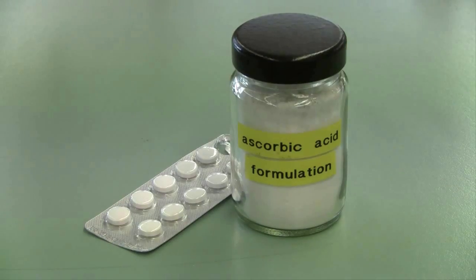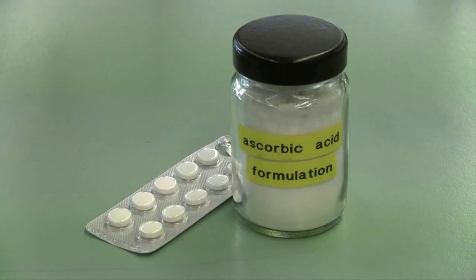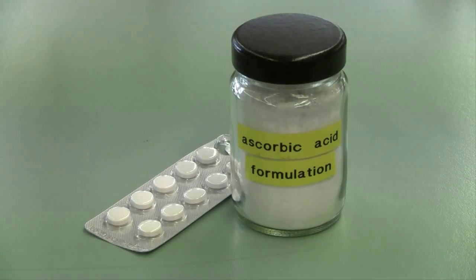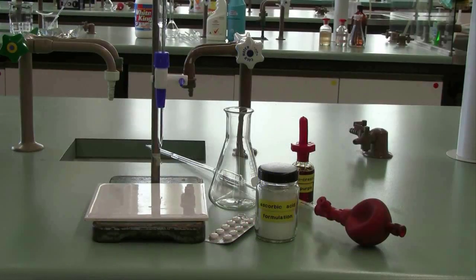The base that we're going to use in today's experiment has yet to be standardized, so we'll be standardizing it, determining the true concentration by titrating it against an acid first.